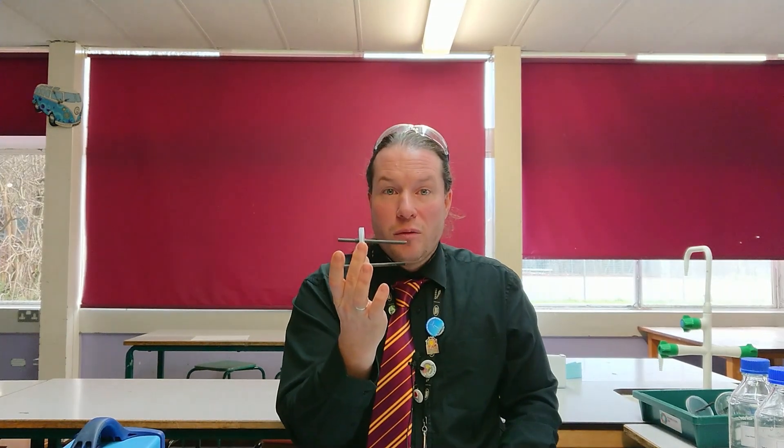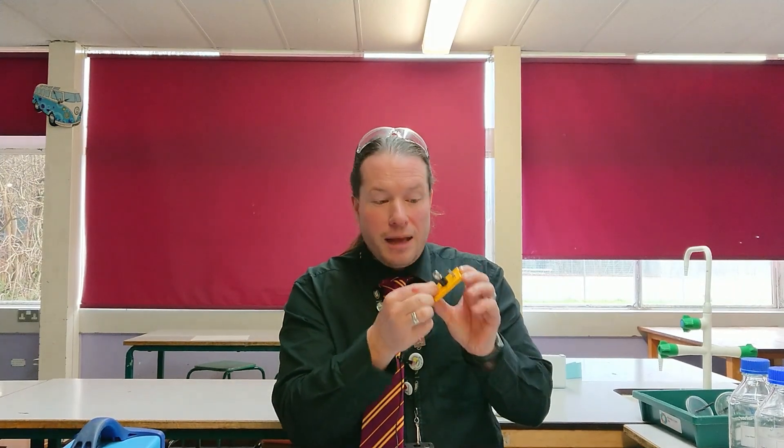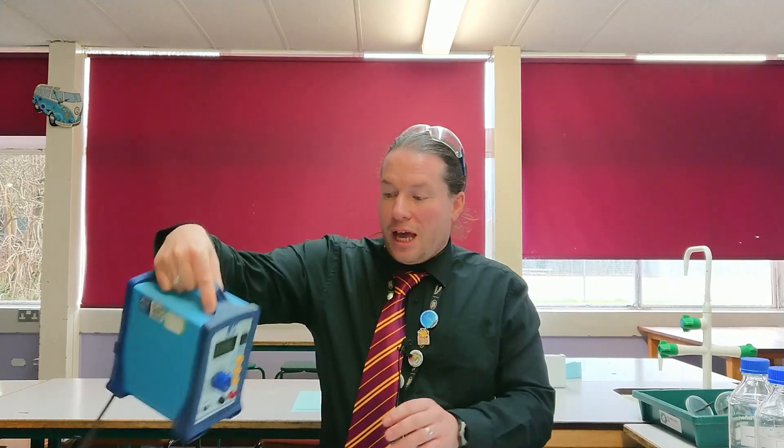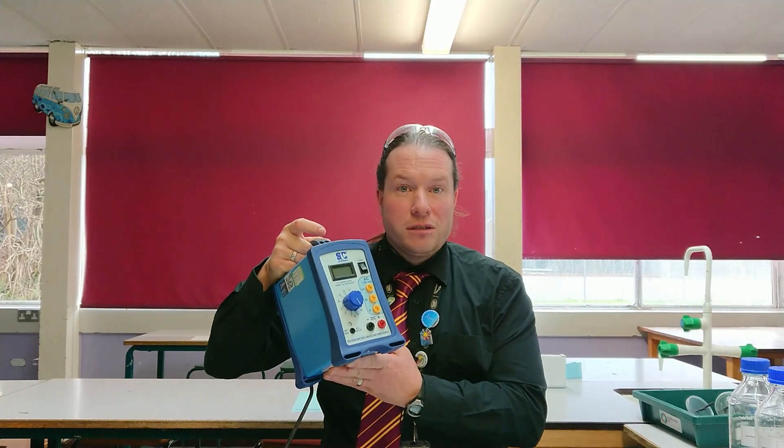We're also going to be using a lamp and our faithful trusty power supply. Now we've had a look at that, we'll get it all set up and look at what it looks like when it's set up.